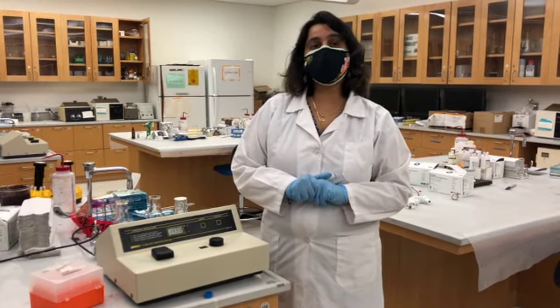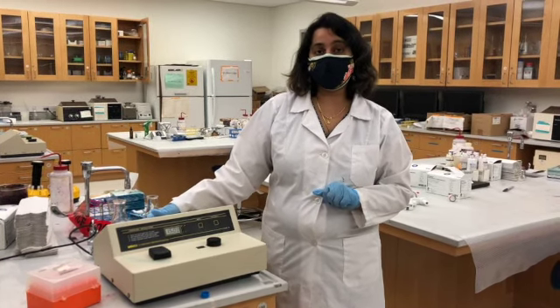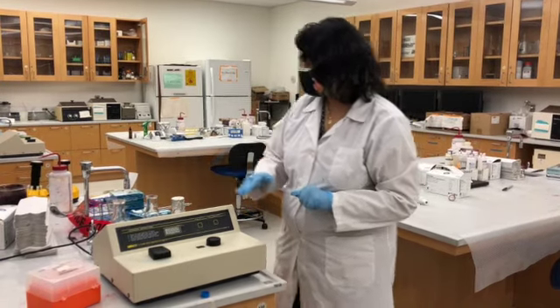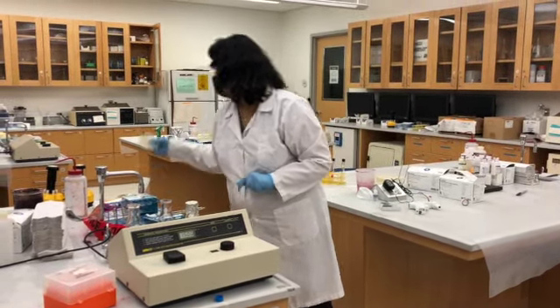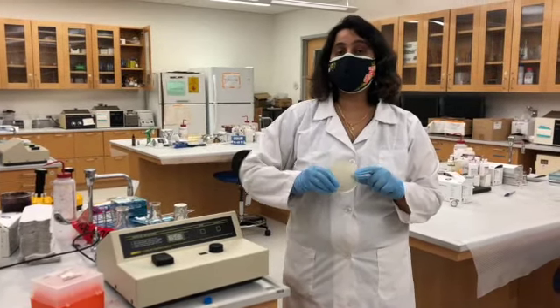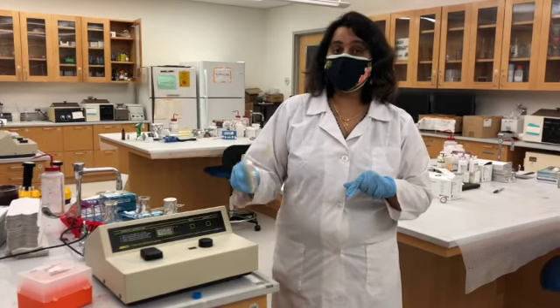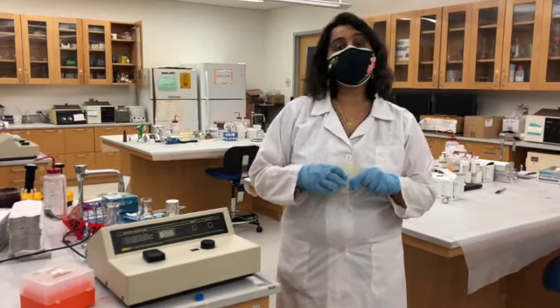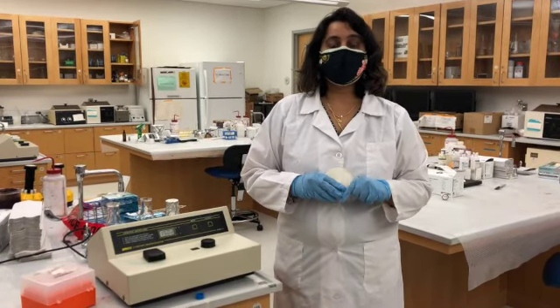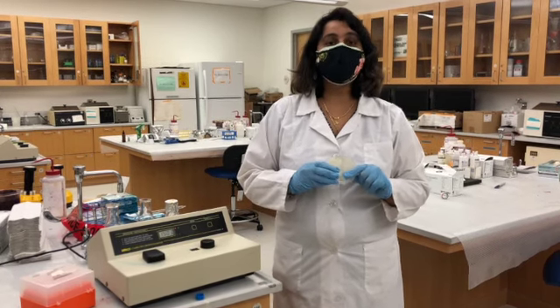So in other words, my question is, we are tracking the growth of the bacteria using the spectrophotometer, but still it's very important to grow the bacterial cells on the TSA plates and observe the growth on the TSA plates also. Even if you see an increase in the absorbance, it's really important to grow them on the solid plates and see that they are actually growing. Why?